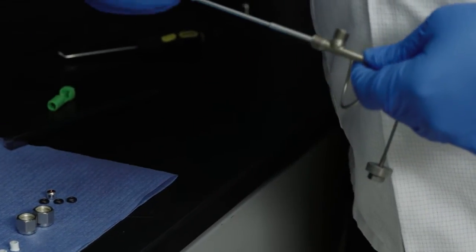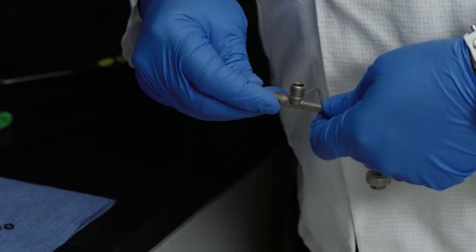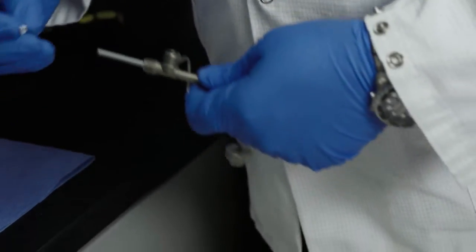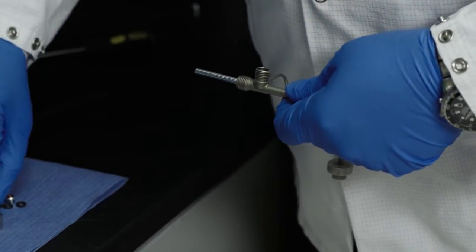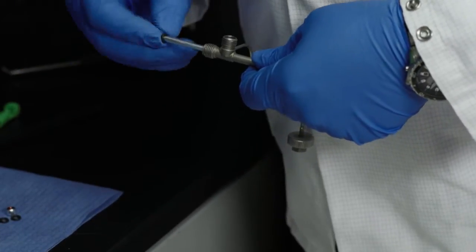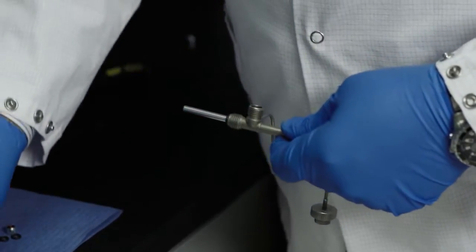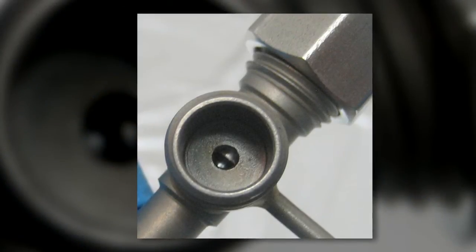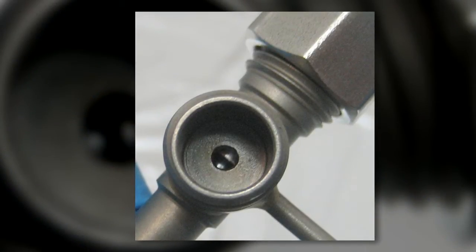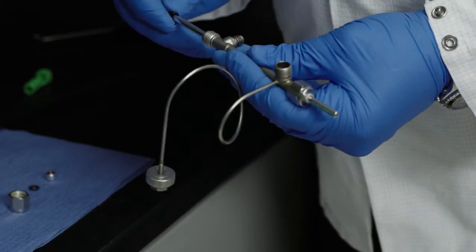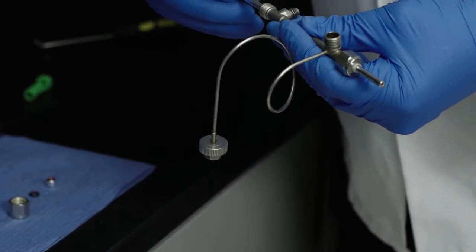Assembling the heater tube is easy. Insert the heater tube into the test section, with the engraved end of the heater tube up towards the test section outlet fitting. Then, assemble the ferrules, O-rings and locking nut and line up the heater tube shoulder with the center of the hole in the outlet. Now repeat the process on the other end, making sure the heater tube shoulder is still aligned with the center of the hole in the outlet.